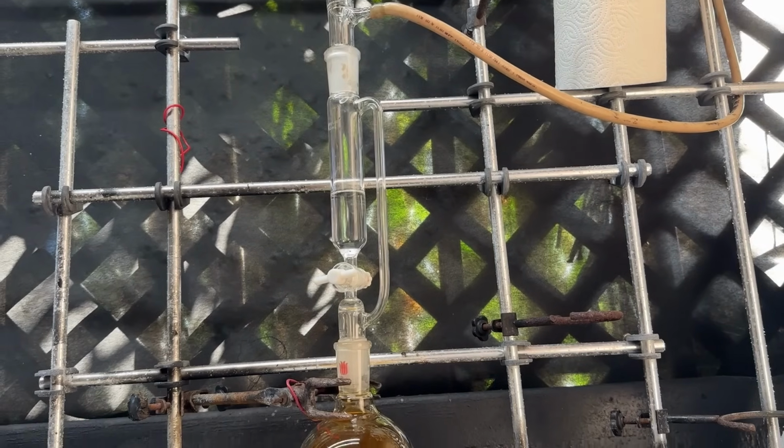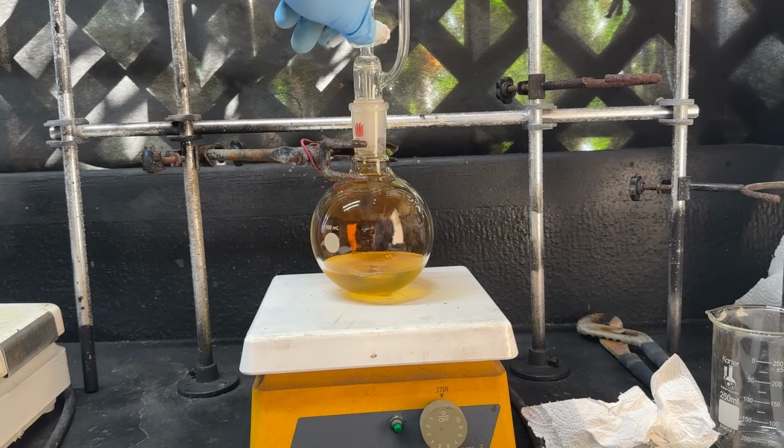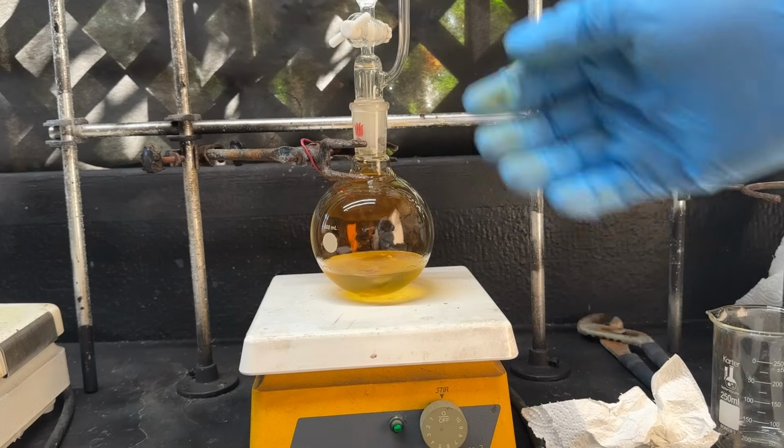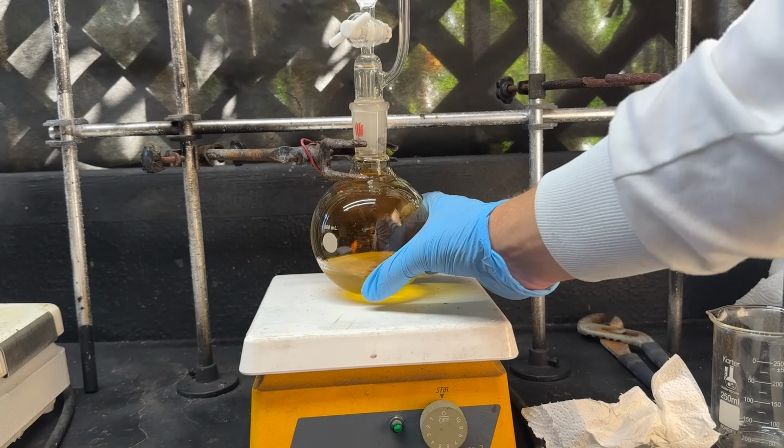Okay, and just like that, we can go ahead and start our oxidation. So all we're gonna do is slowly add in our isoamyl alcohol and just make sure it doesn't get too hot. You wanna add a small amount at a time because the oxidation can get exothermic very quickly. So we just wanna slowly add that in and let it react.